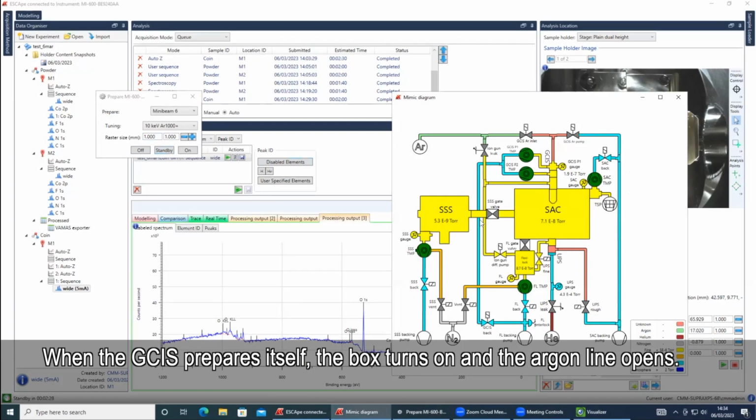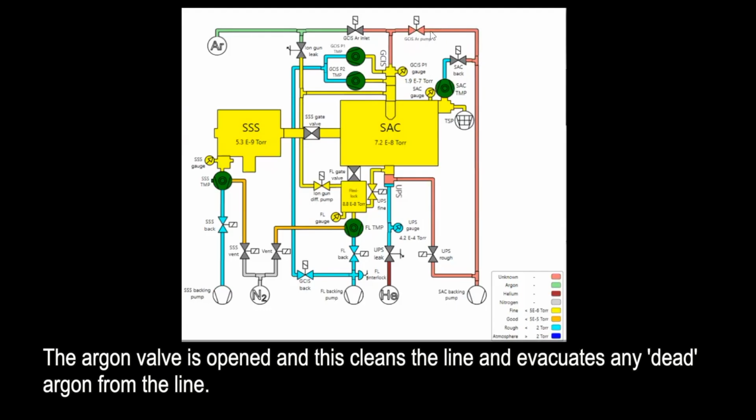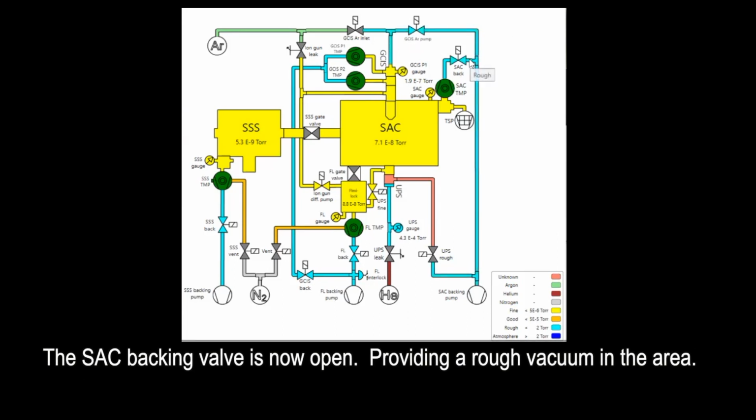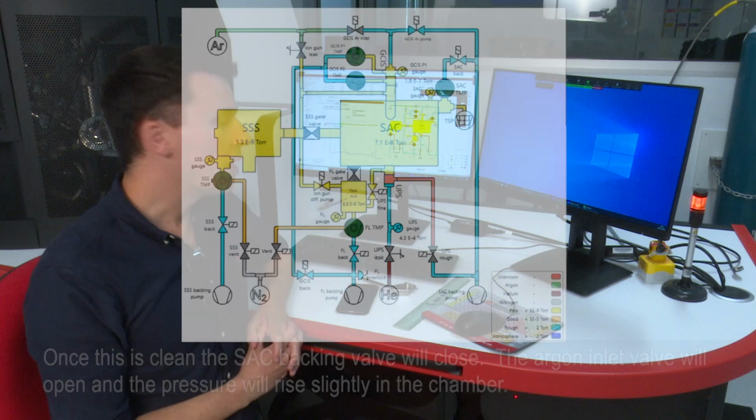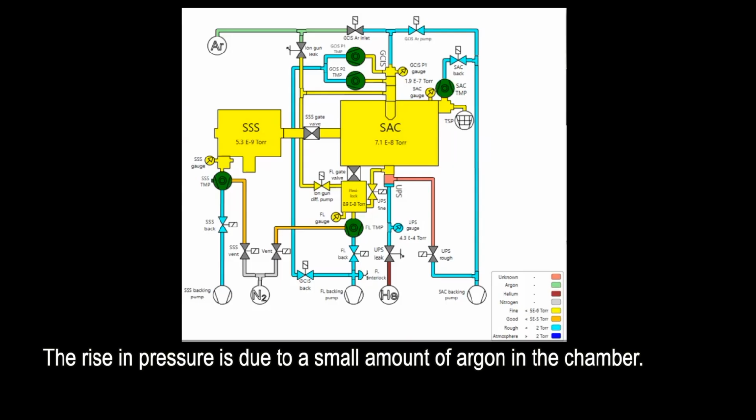When the GCIS prepares itself, the box turns on, but the argon line also opens. We'll see the mimic diagram change as time goes by. It takes about 5 minutes. The argon valve is opened, and this just cleans the line. It evacuates any dead argon out. The sac backing valve is now opened, so this part here is all under a rough vacuum. Once this is clean, that valve will close, and then the argon inlet valve will open, and the pressure will rise slightly in the chamber, because we have a very small amount of argon in there.